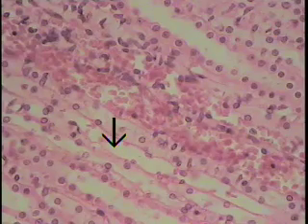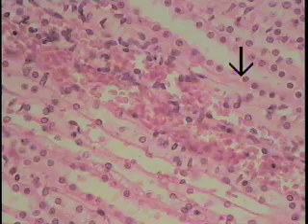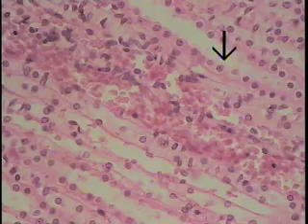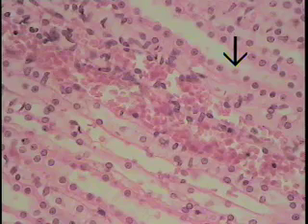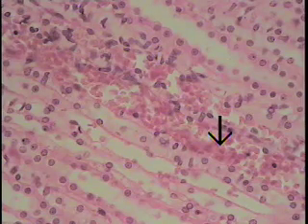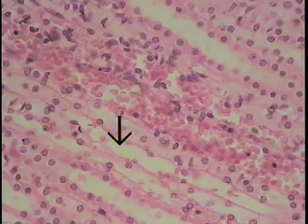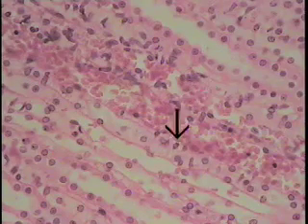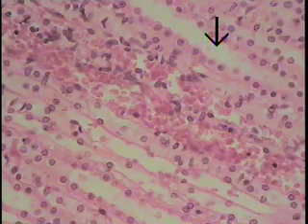This is a high-power view of the medullary region, or the medulla, just to illustrate some features that one can see. This tubule here is a collecting tubule, lined by very distinct cells — a columnar type of cell, light-staining with very distinct cell boundaries. These vessels filled with erythrocytes, or red blood cells, lying in this area are the vasa recta. And this tubule here, lined by a very flattened simple squamous type of epithelium, is a thin segment of the loop of Henle — perhaps another collecting tubule here. So a thin segment of the loop of Henle, the vasa recta, and then a collecting tubule, with the pointer in the lumen of a collecting tubule.